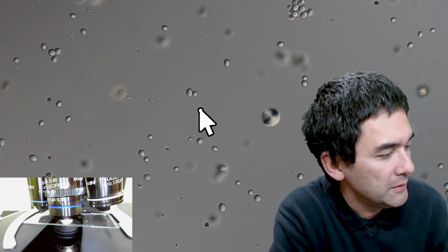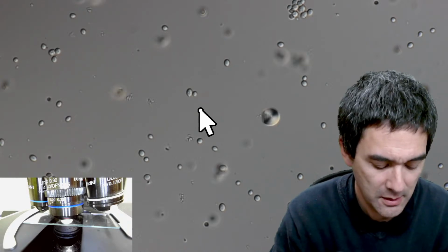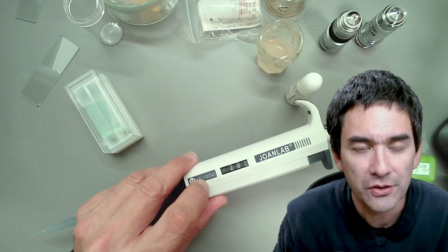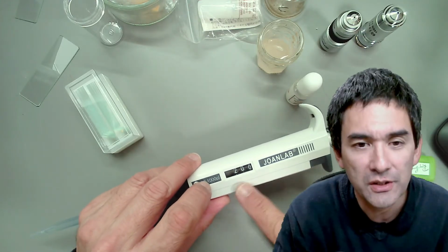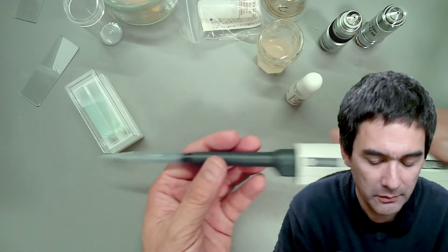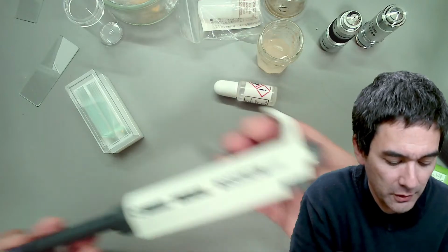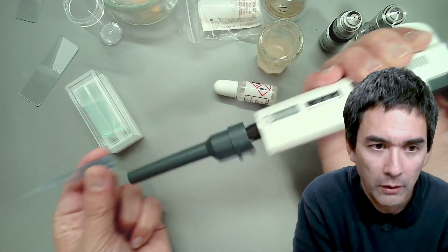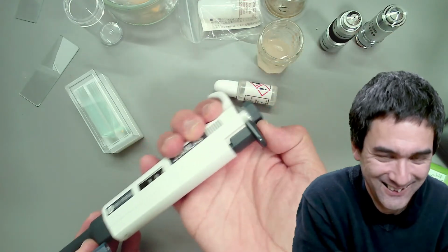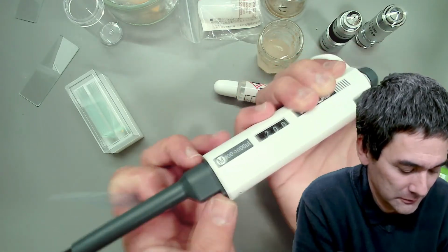So, volume size of the pipette is a question. Yep. Why not? Before I forget, this one over here goes all the way up to 1,000 microliters. It's a milliliter, but I'm not using this for measuring out. I'm just using this for essentially pulling out samples. If you press this button over here, you're able to throw off the tip, and sometimes the whole thing comes off. That's the quality aspect. But otherwise it's fine.